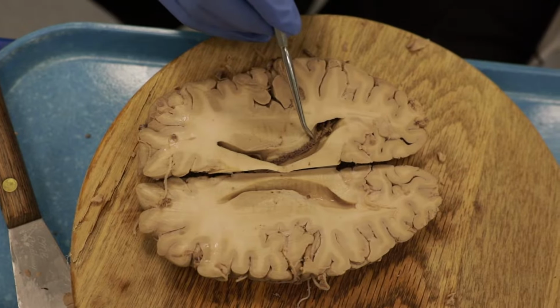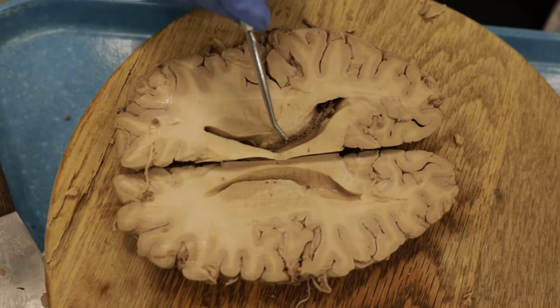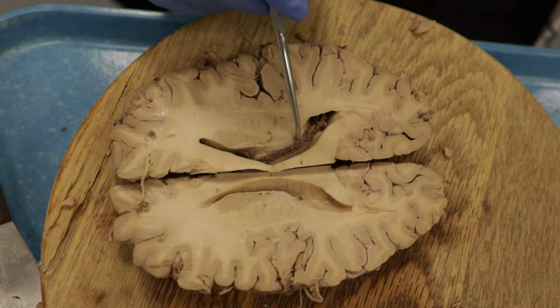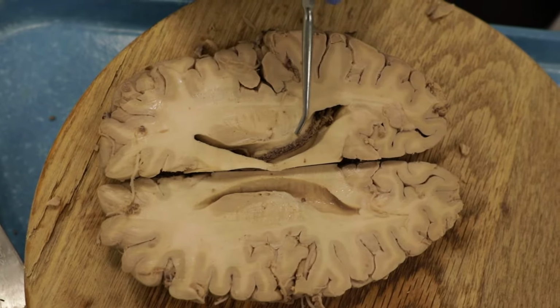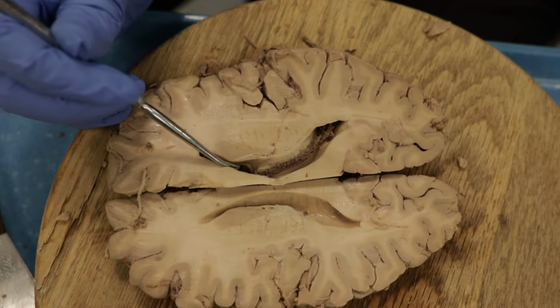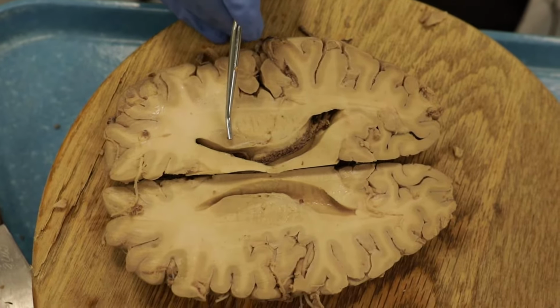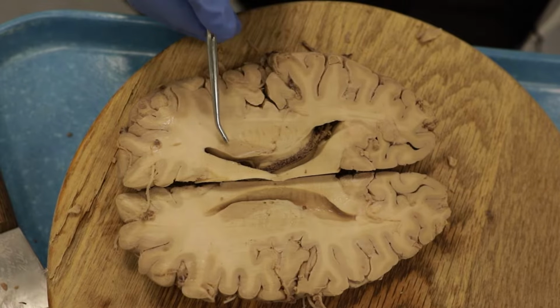All right, so all of this material here is choroid plexus, again producing cerebral spinal fluid here in the lateral ventricle. Now there's a large nucleus right here, and as we go deeper down, we'll see the thalamus. We'll cut through this, and we'll also appreciate that here is the caudate nucleus. Caudate is distinctive because it's always bulging into the lateral ventricle. So here's the caudate nucleus.